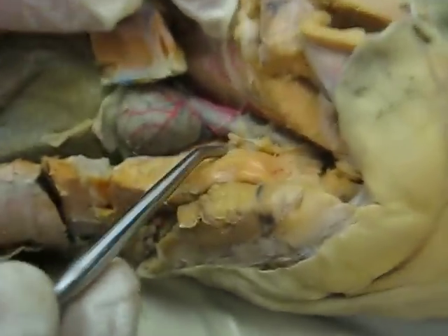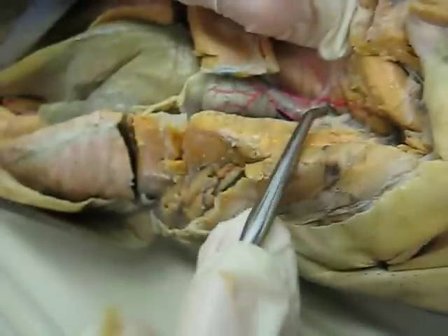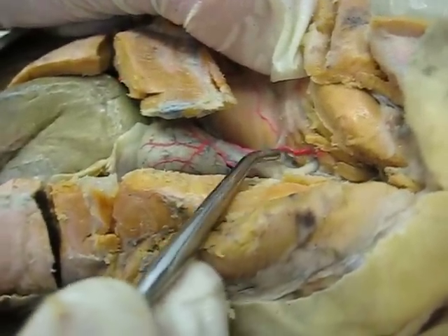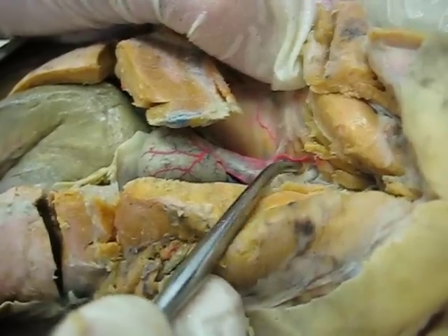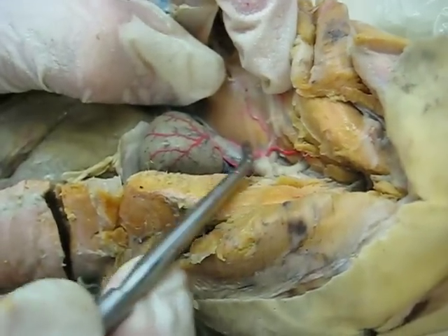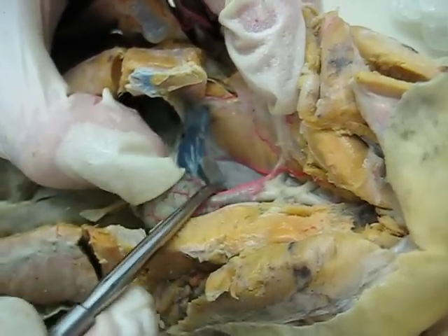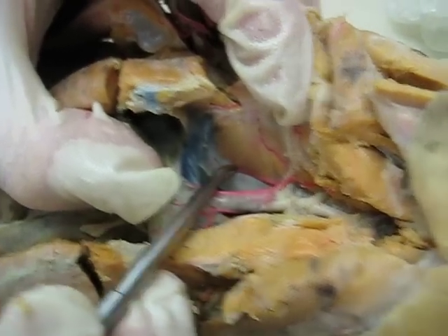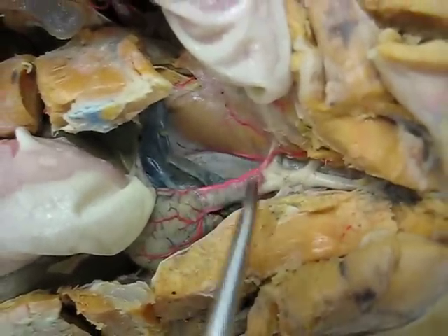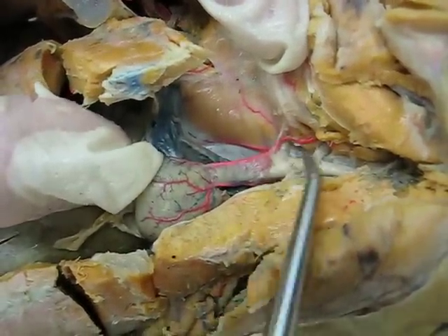Coming off a collector loop up in the area of the heart is a hypobranchial artery, running along the muscular wall. The hypobranchial artery comes over here and branches: one major branch is the coronary artery going to the heart, and the other major branch is a red artery going deep along the pericardial cavity — the pericardial artery. So the pericardial and coronary join to form the hypobranchial artery, and all of those are red.